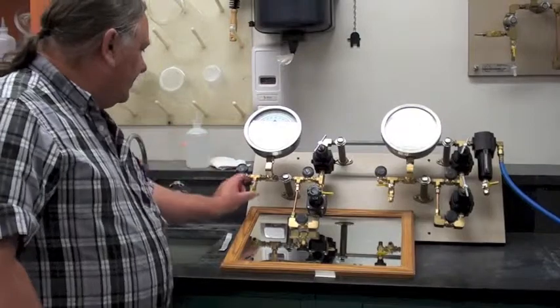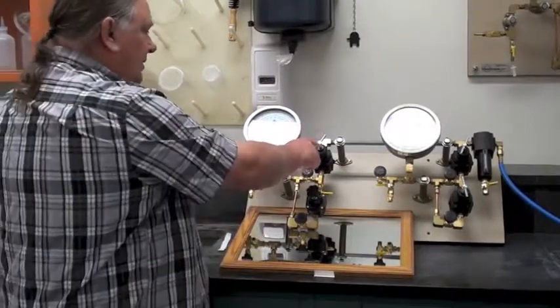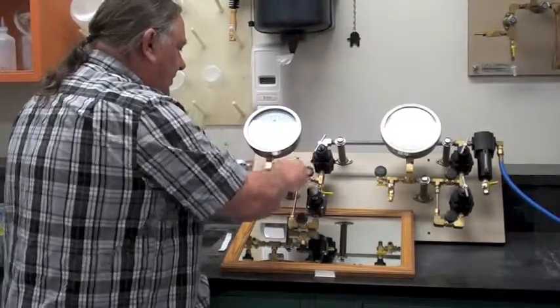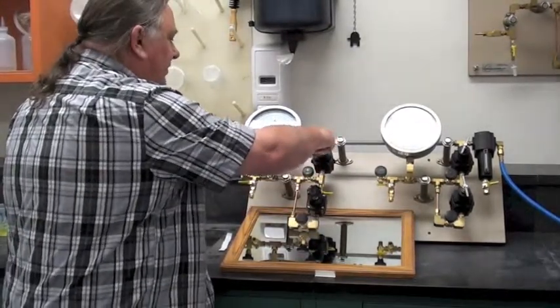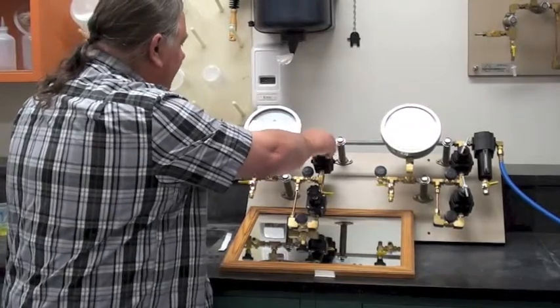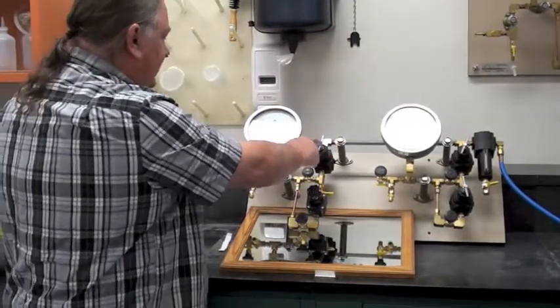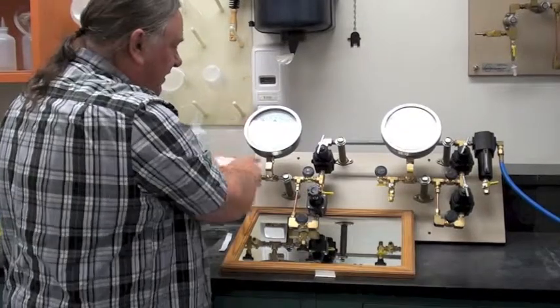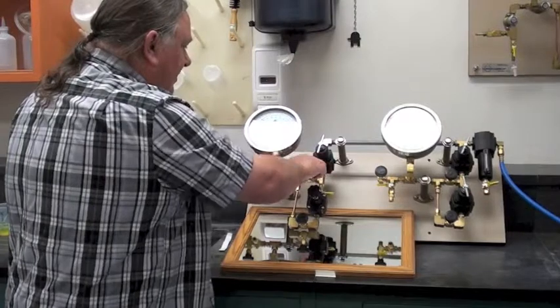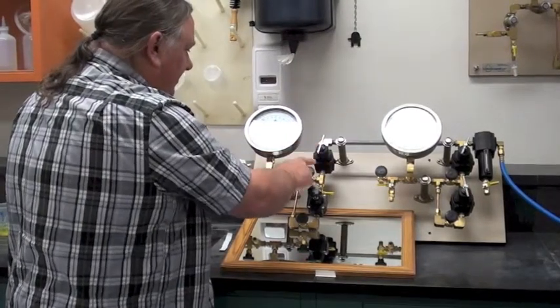The first thing I want to do is adjust the upper regulator to some pressure. So off, open, now we're going to put some pressure. I'm just going to go to, it doesn't matter, that's fine. You've got between 2 and 2.5 bars, 2 here, and then we turn that off. So we're at 2 to 3 bars, off.